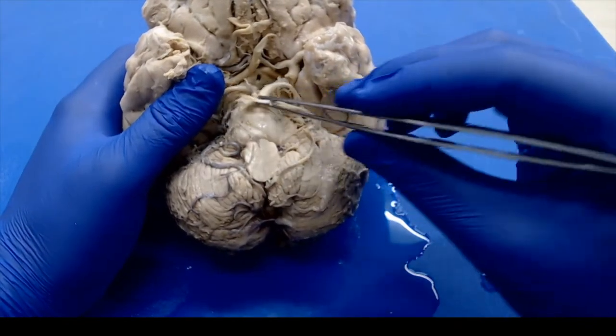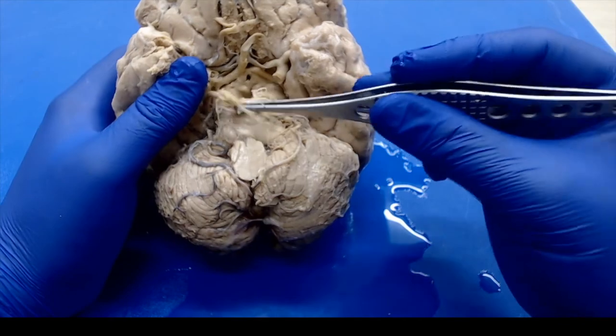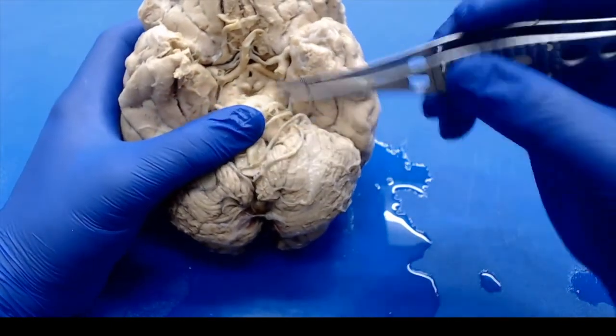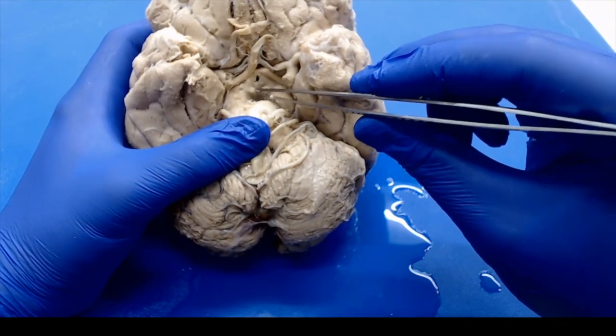And then you can also refer to diagrams to get a nice picturesque view of that as well, and also some of your notes from anatomy. Now we're going to start looking at cutting, and I'm not going to cut this brain because it has a better vasculature supply, but I do want to show you what I was trying to show you in the previous brain, which is the mammillary bodies.